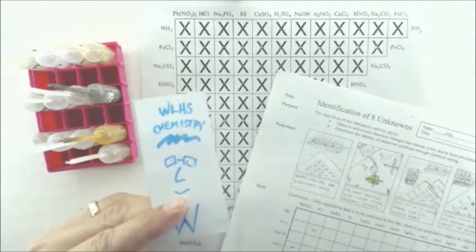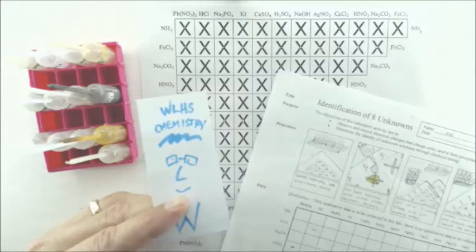Okay, this is the video for the beginning of the identification of unknowns lab. Due to shortage of time, I'm going to be doing the knowns part here for you, and you'll be recording the data, and then you'll do the fun part, which is the unknowns, in class coming up soon.